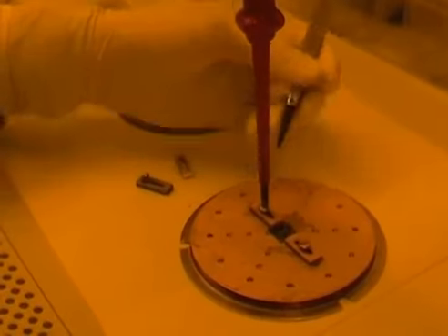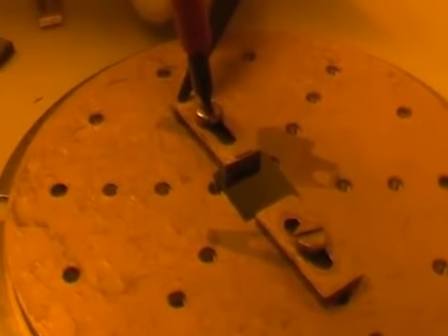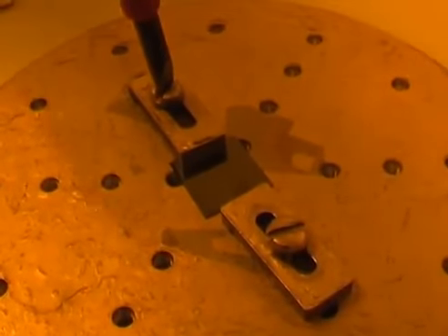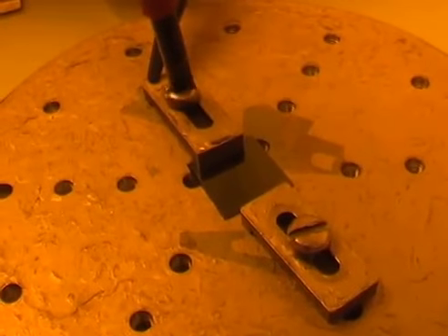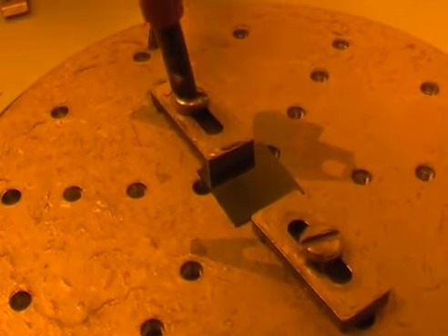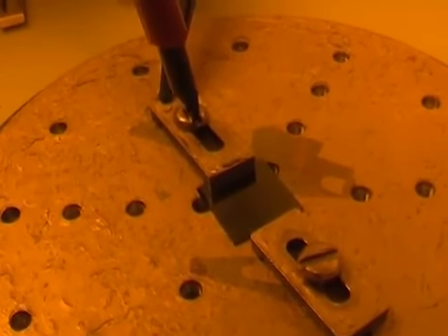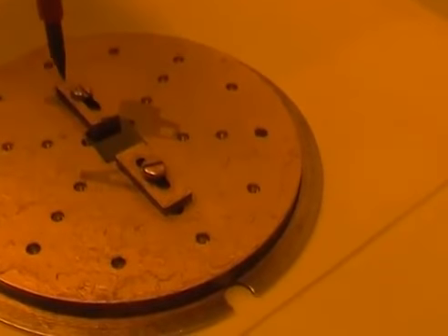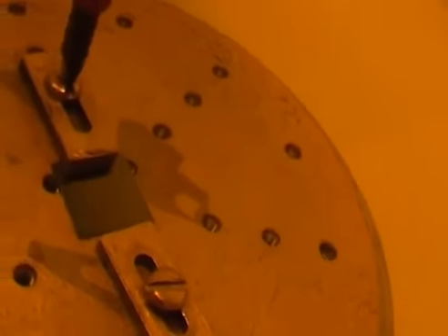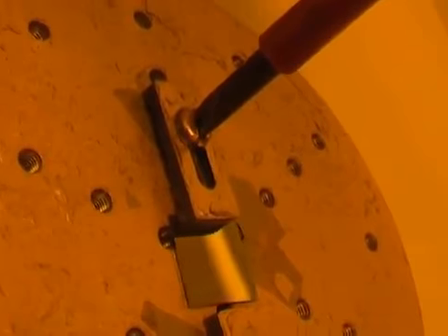put the clamp in place in order to make sure that, if I want to use just one clamp, as it might be requested by the pattern that I have on my sample. Maybe I have a type of pattern on my sample that occupies most of the space, then if I can only use one clamp to make sure that the sample is horizontal, I need to put the clamp at least 2 millimeters inside the sample. So I need to make sure that there is always a space of 2 millimeters that is free of any pattern whenever I pattern my sample.